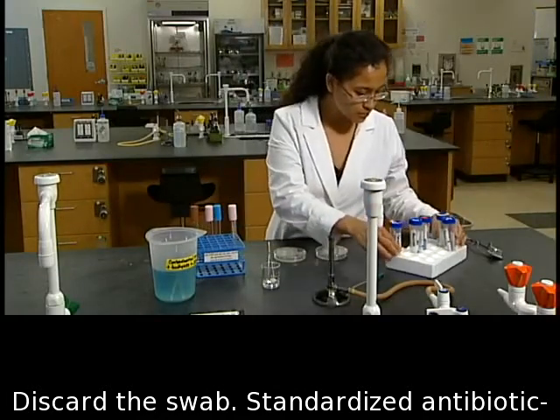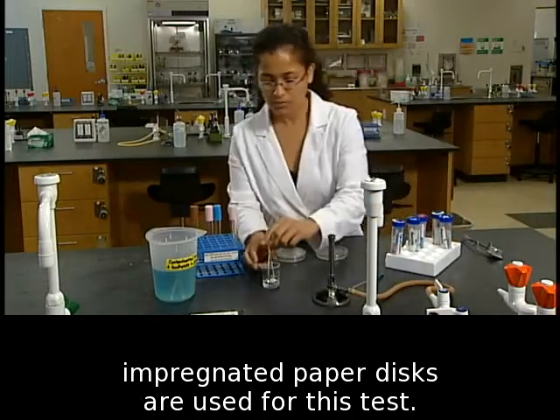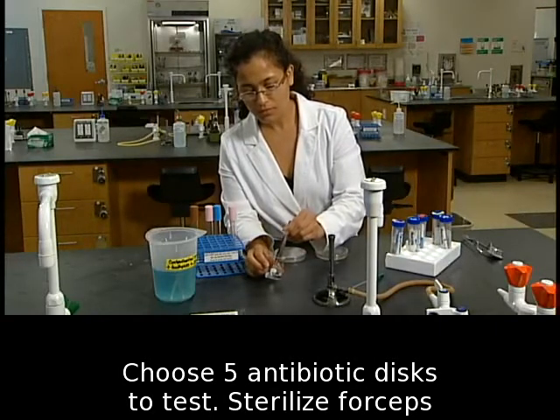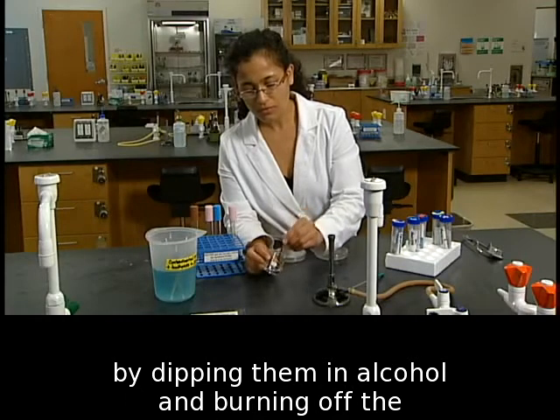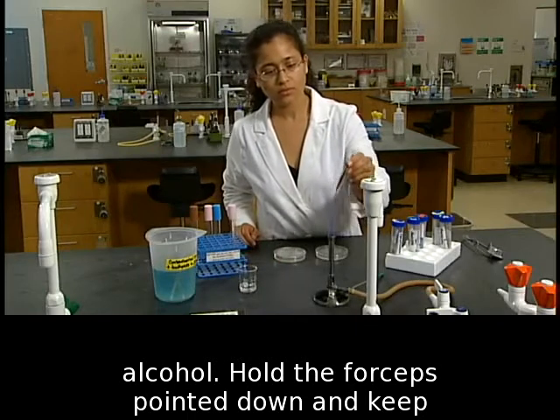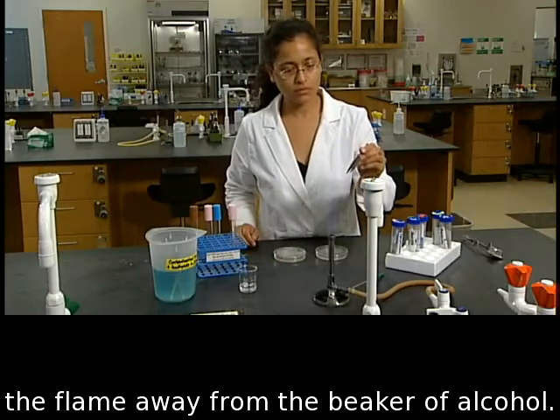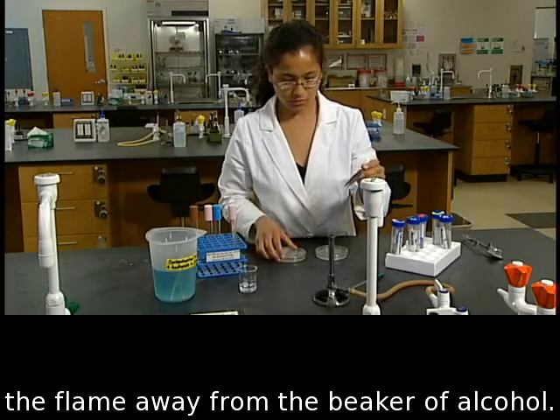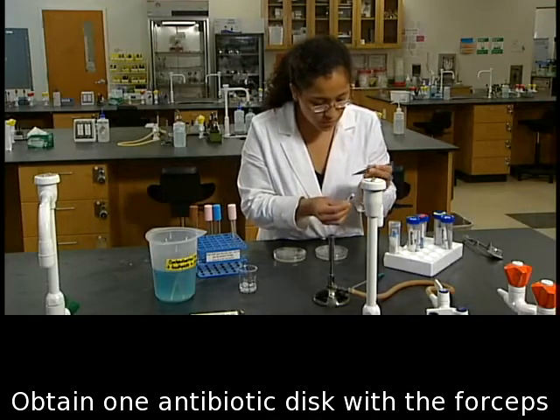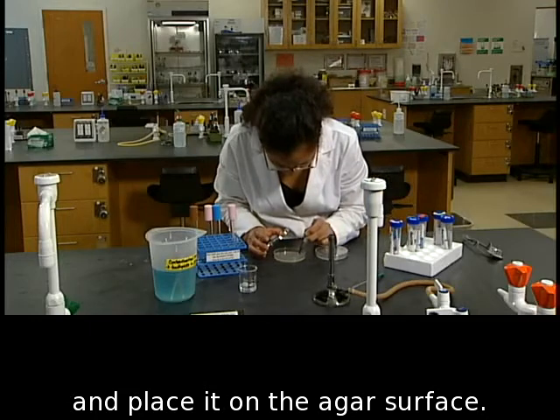Standardized antibiotic-impregnated paper discs are used for this test. Choose 5 antibiotic discs to test. Sterilize forceps by dipping them in alcohol and burning off the alcohol. Hold the forceps pointed down and keep the flame away from the beaker of alcohol. Obtain 1 antibiotic disc with the forceps and place it on the agar surface.